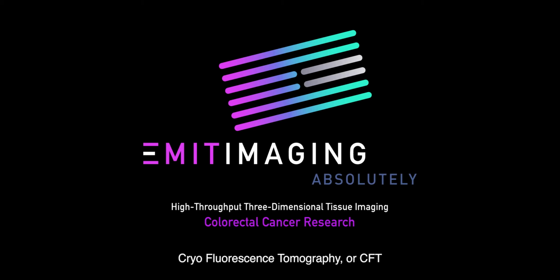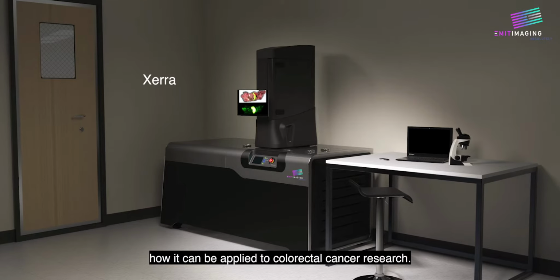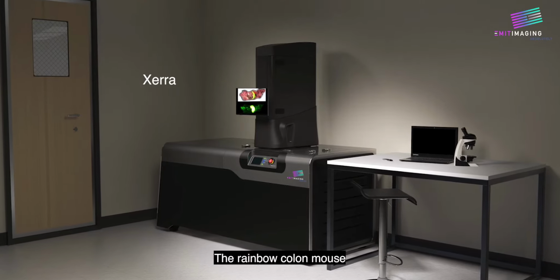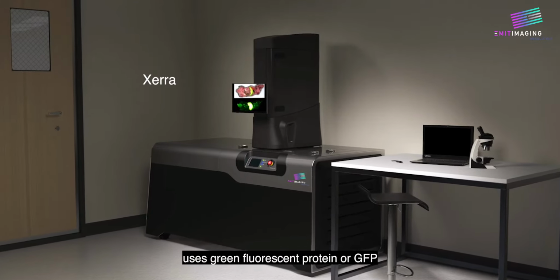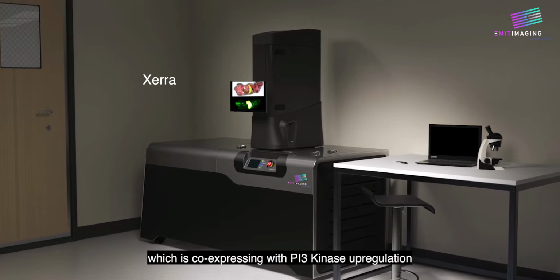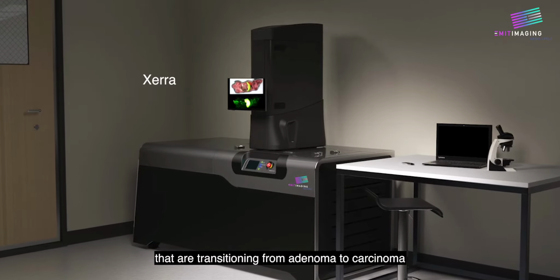Cryo-Fluorescence Tomography, or CFT, is a relatively new imaging technique, and in this video we describe how it can be applied to colorectal cancer research using the Xerra system. The rainbow colon mouse uses green fluorescent protein, or GFP, which is co-expressing with PI3 kinase upregulation, in order to visualize cells that are transitioning from adenoma to carcinoma.